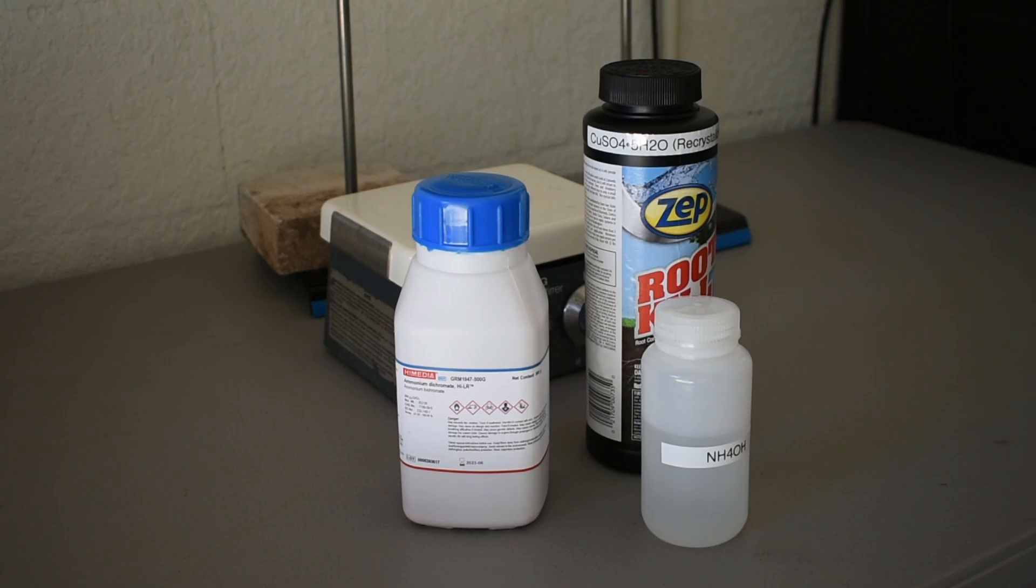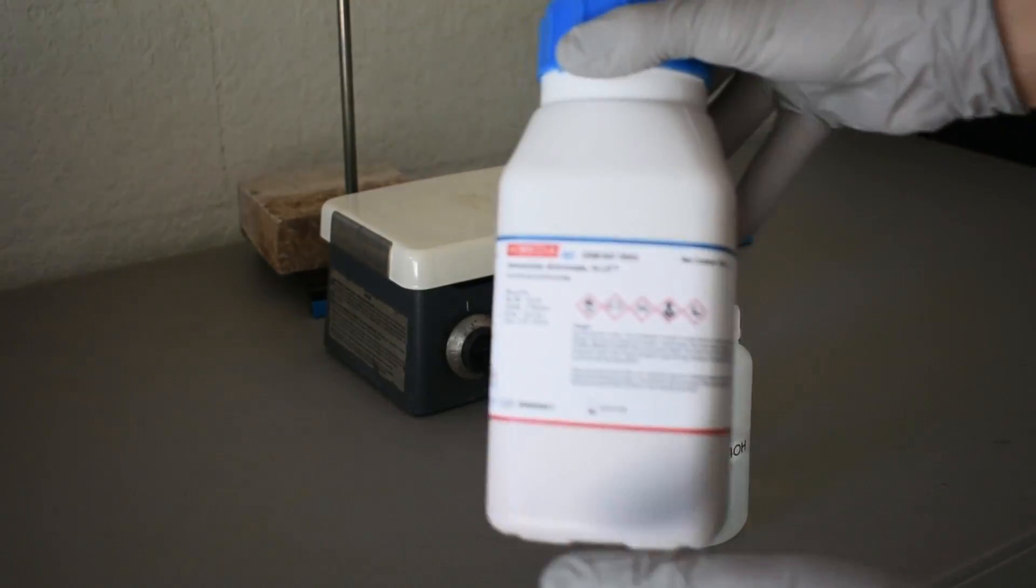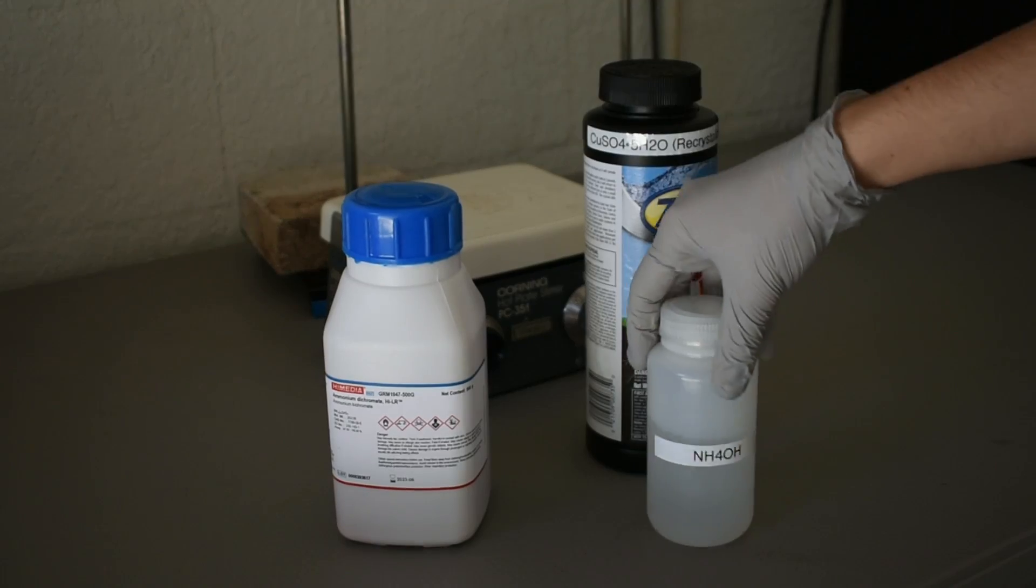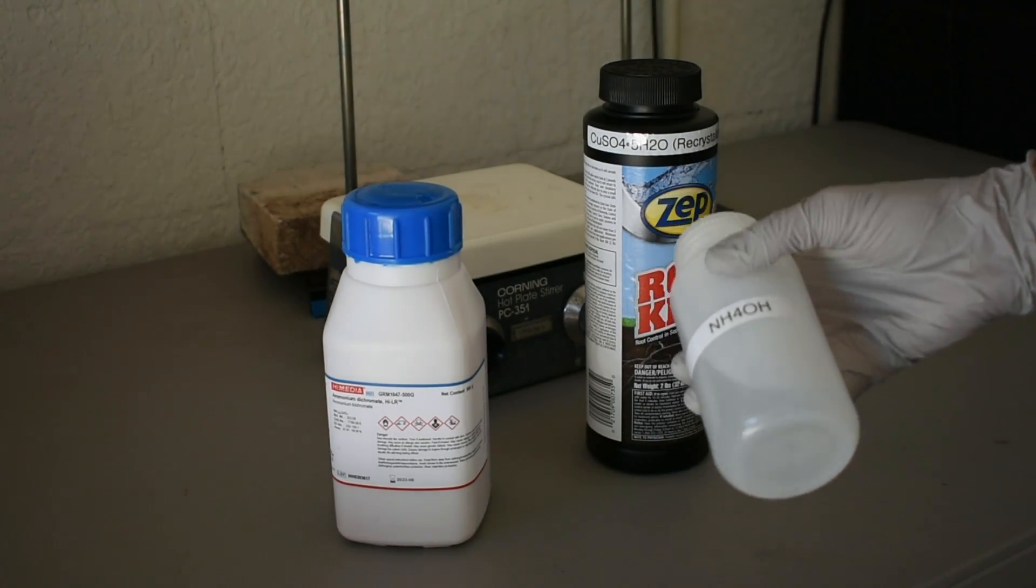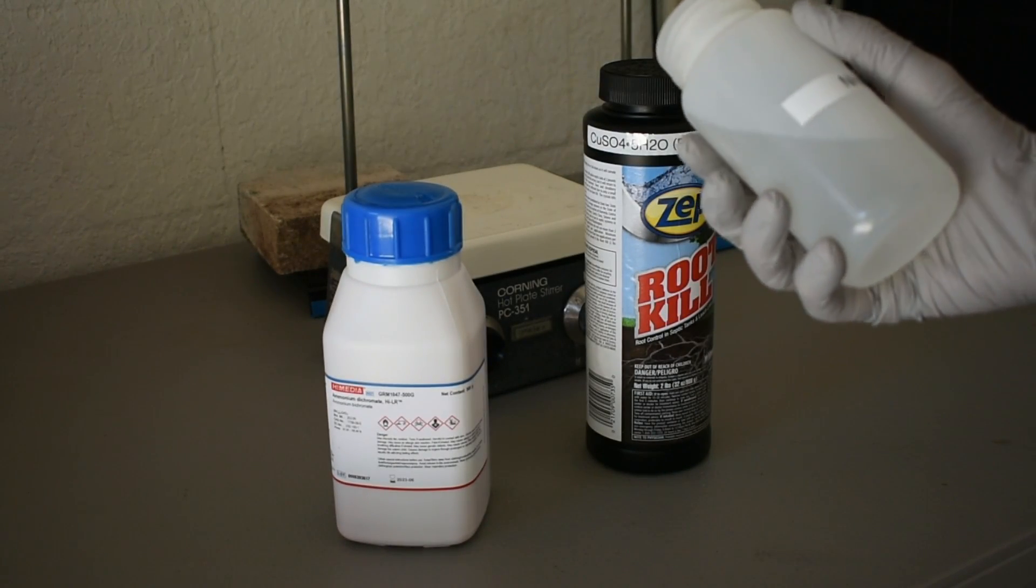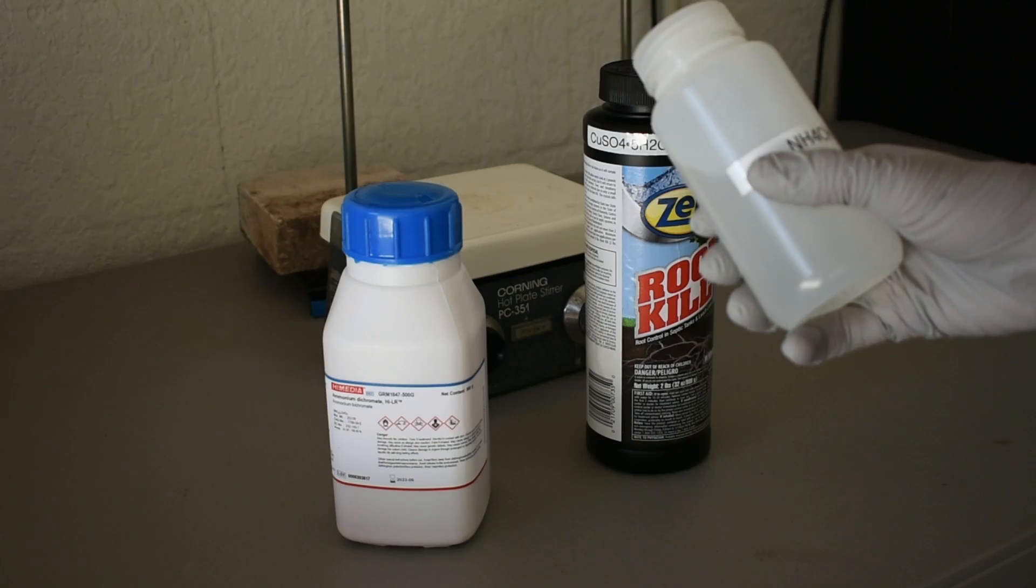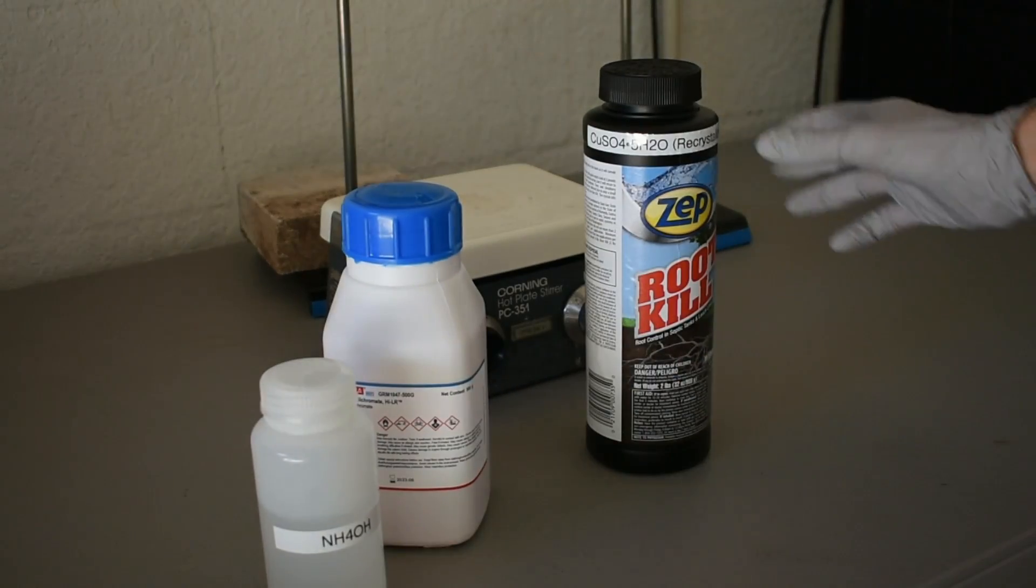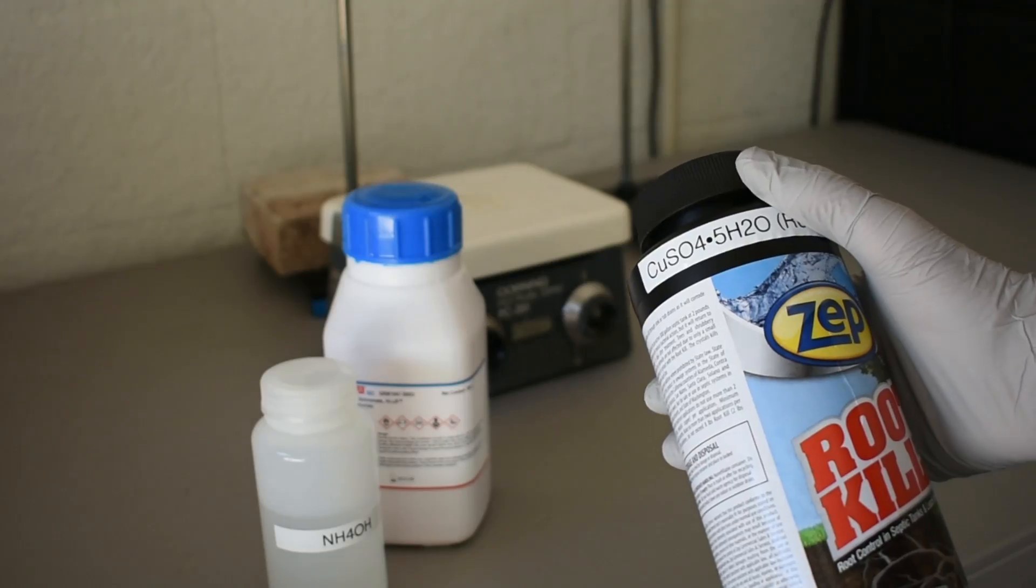I have some ammonium dichromate, some ammonium hydroxide solution—although I tried to measure the density to find the exact concentration of this, but it just doesn't seem to be working—and then some copper sulfate pentahydrate.